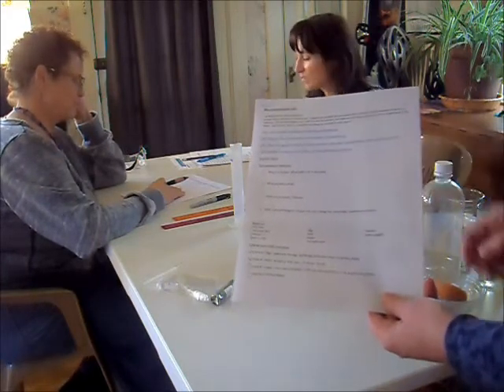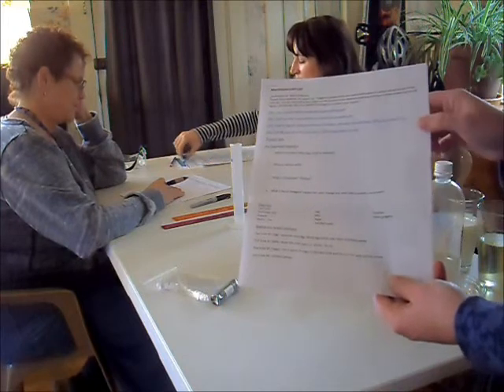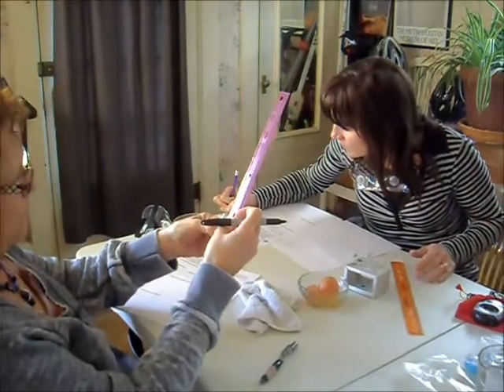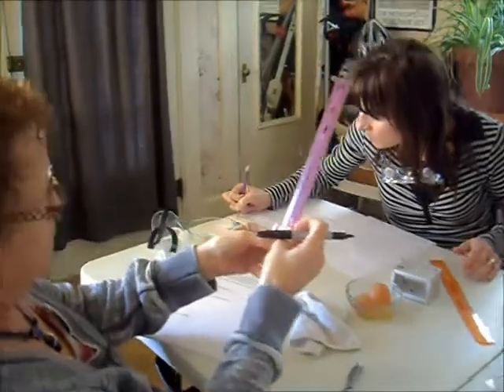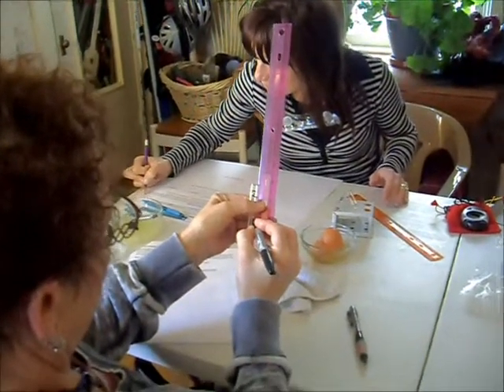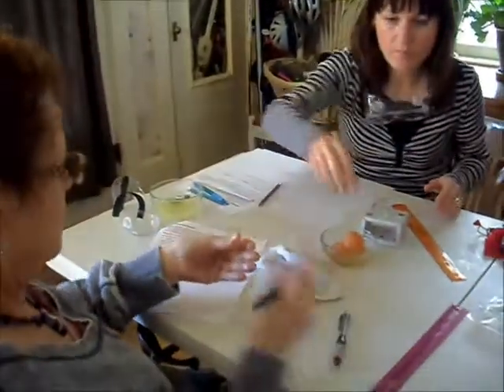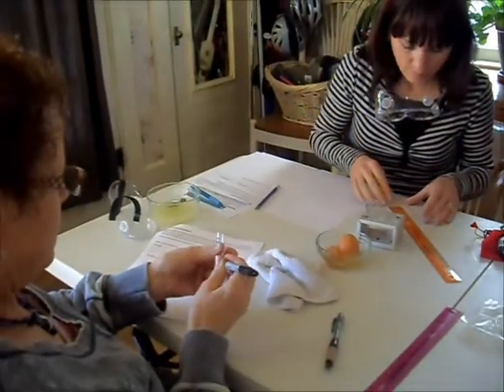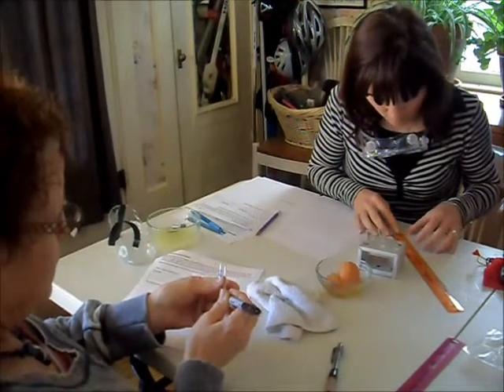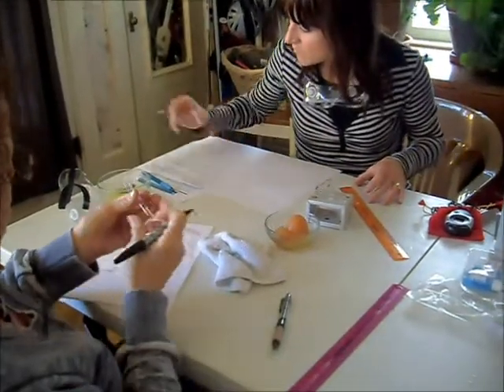The first thing to do when you get the document is to answer all the pre-experiment questions. Right now Melanie is marking her test tube two centimeters from the bottom, and we were having a discussion about whether it would be appropriate to mark it from the round part of the bottom of the test tube or the flat where it starts to be a perfect cylinder. Just write what you do in your report.